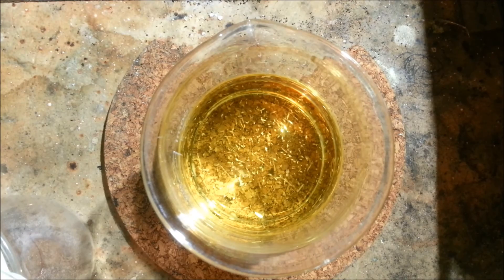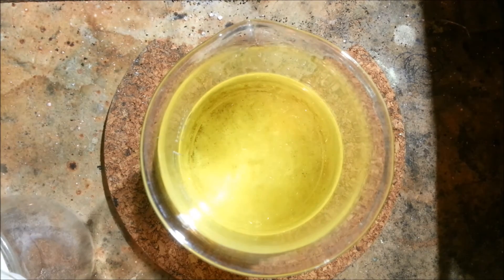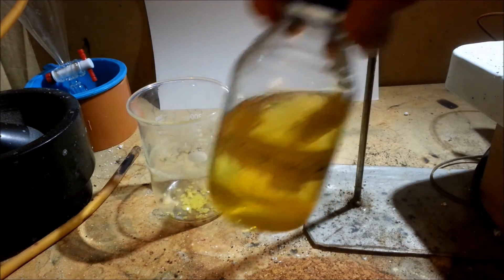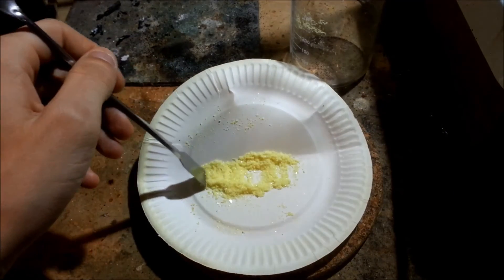The crystals stick quite well to the bottom, so the easiest thing is to decant the solvent into a bottle for later sulfur extraction or distillation to purify the solvent. The crystals were scooped out onto a paper plate and left to dry in the fume hood. The result was 7.2 grams of fluffy yellow crystals.